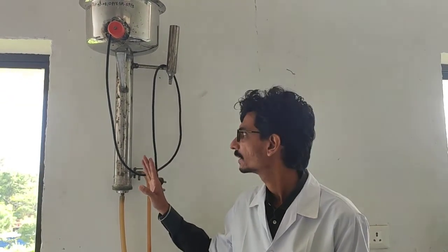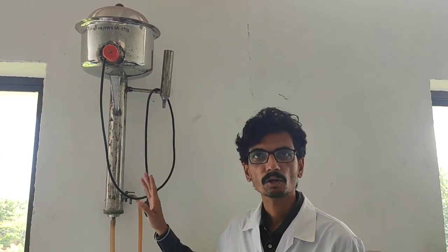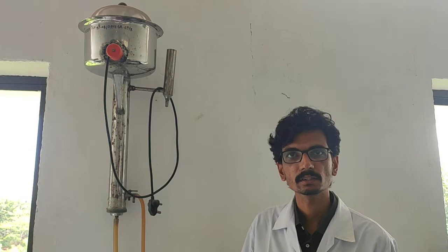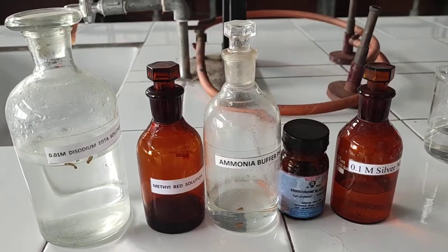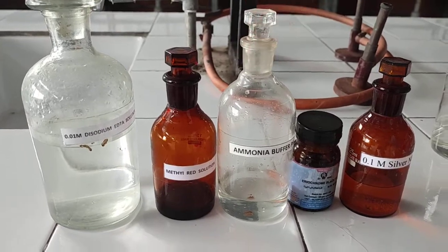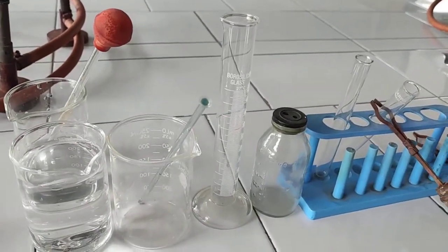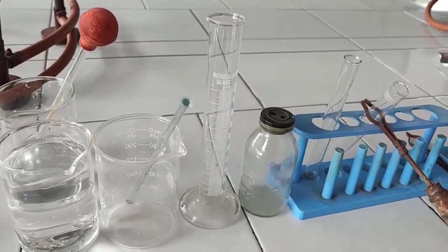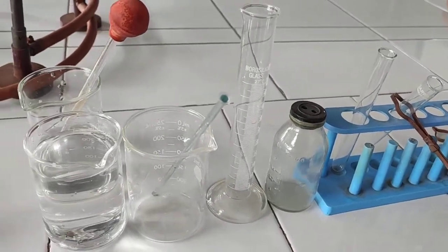After collecting this distilled water, to confirm whether it is properly distilled or not, we carry out various chemical reactions. These are the chemicals, glassware, and various apparatus required for this experiment.